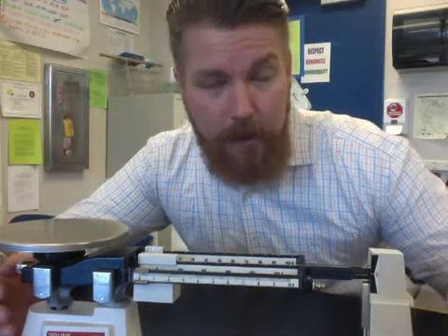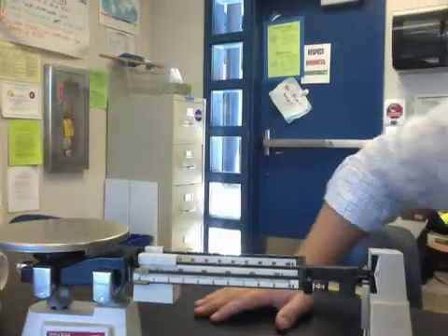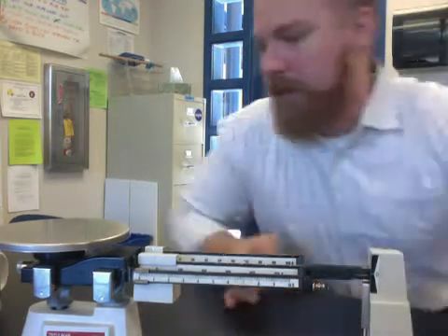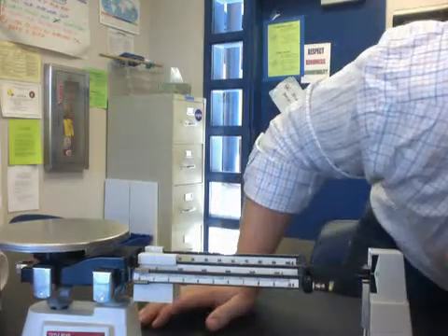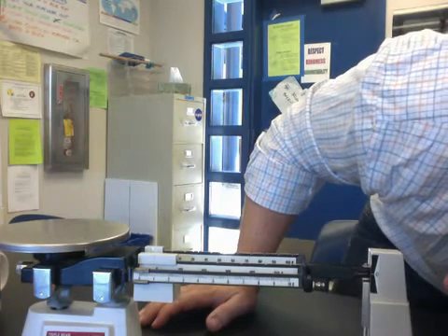If you turn it counterclockwise, the arm will move up. If you turn it clockwise, the arm will move down. Ours right now looks pretty good, but not perfect. So I'm going to turn it counterclockwise just a little bit — I need it to move up a little bit. And that's looking pretty good, so I think we're good.